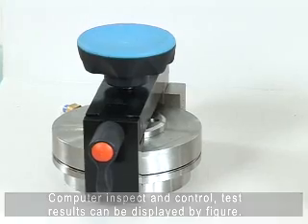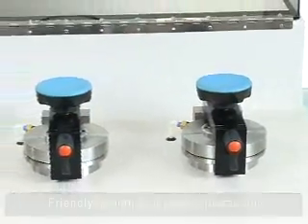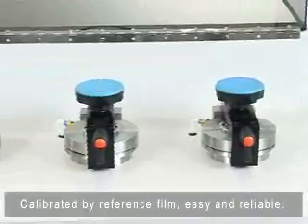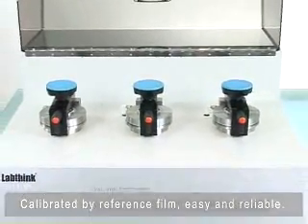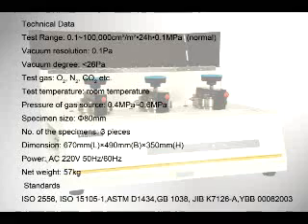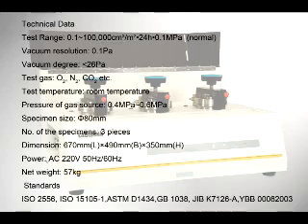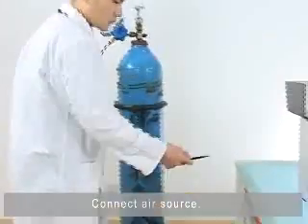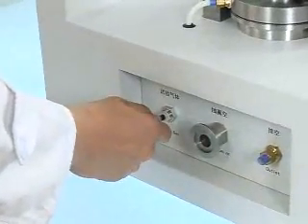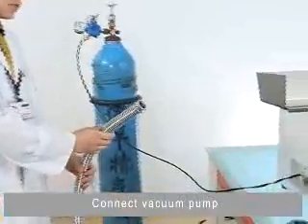The system features friendly human-equipment interaction and is calibrated by reference film for easy and reliable operation. To begin setup, connect the air source and connect the vacuum pump.